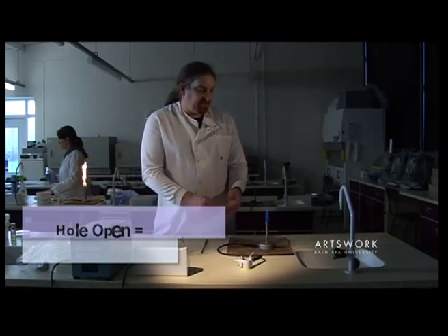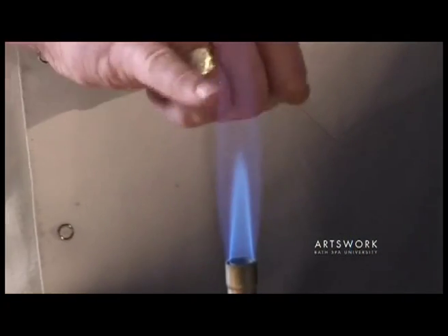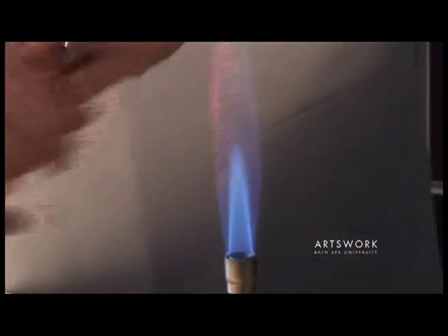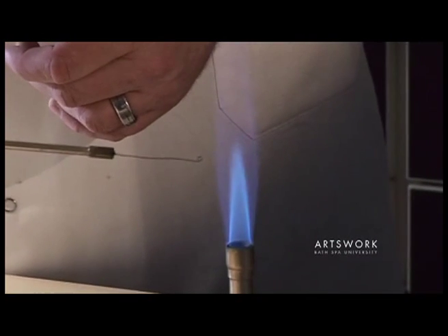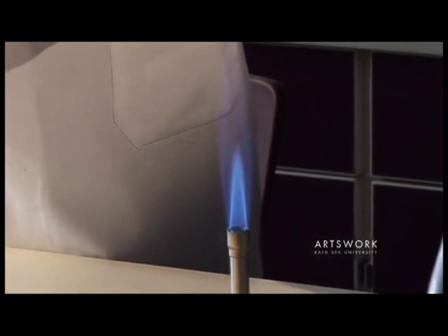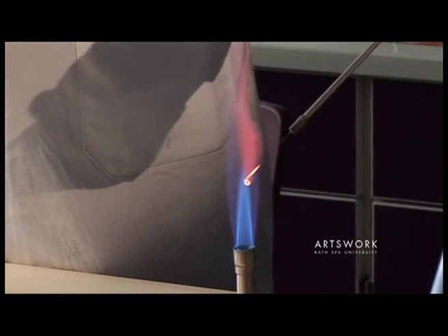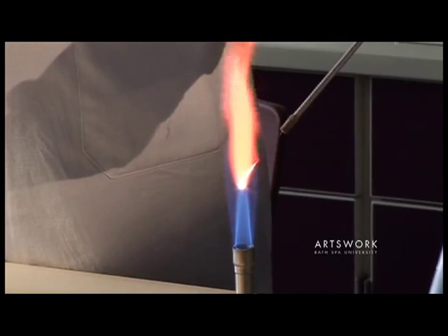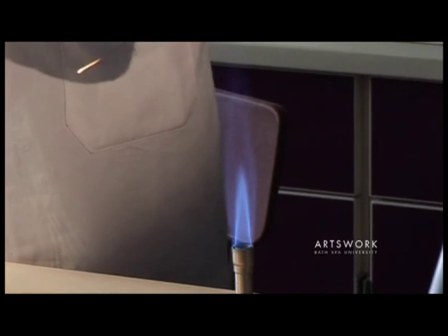If you notice the flame, you've got an outer cone of blue gas and a much smaller cone in the middle. The hottest part of that flame is at the peak of that inner cone, so if you're using the flame to sterilise equipment, put it directly into the top of that blue cone and almost instantly you can see the metal loop has become red hot.